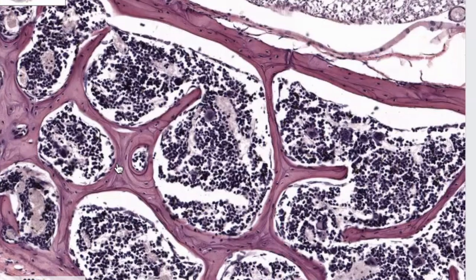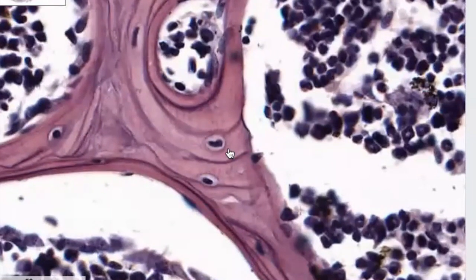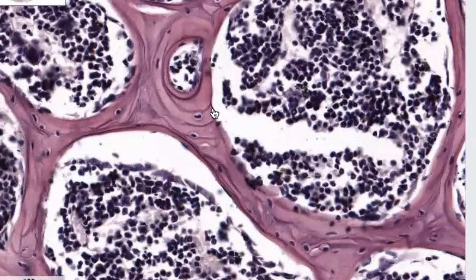So you've got these long struts. On each of those structures right here, you have osteocytes in a lacuna, right? Just like you had chondrocytes in a lacuna for cartilage, you have osteocytes in a lacuna for bone. Now bone's going to have a lot more unique structure, but for this spongy bone sample, I want you to recognize the tissue, which is spongy bone, and I want you to recognize these structures, which are trabecula, and then there's the osteocytes in lacuna. All right, so that's a spongy bone sample.